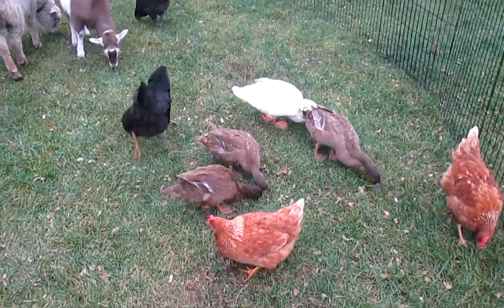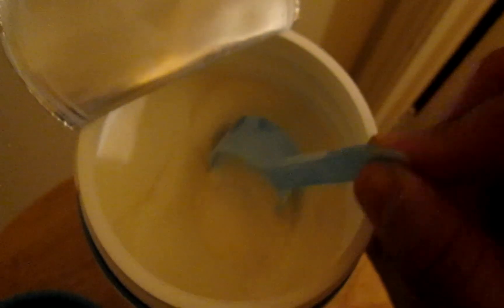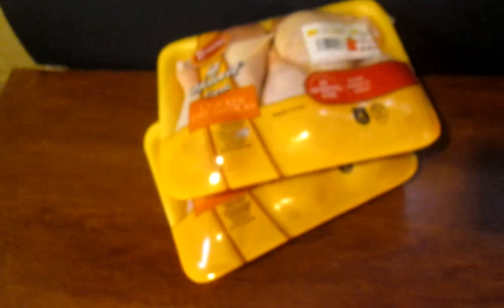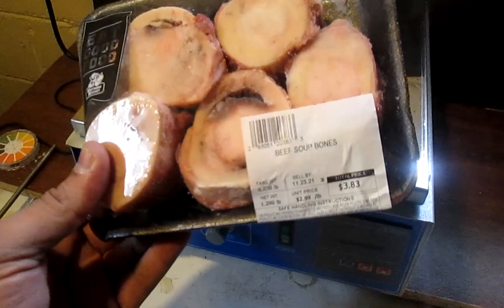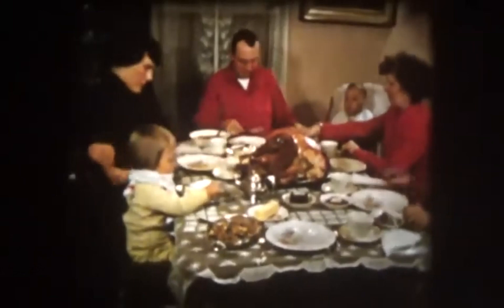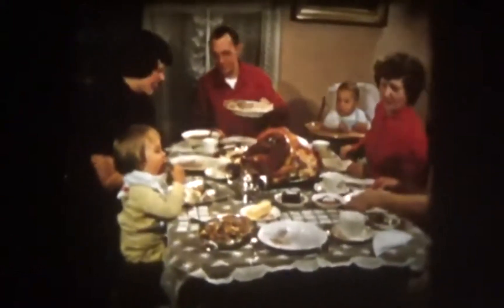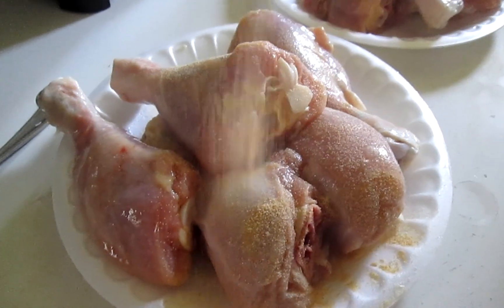Collagen is available as a food supplement made from beef. I will compare its composition with some store-bought chicken, pork, beef, and turkey — right on time to ruin Thanksgiving for everyone. The process is the same for all the meats.